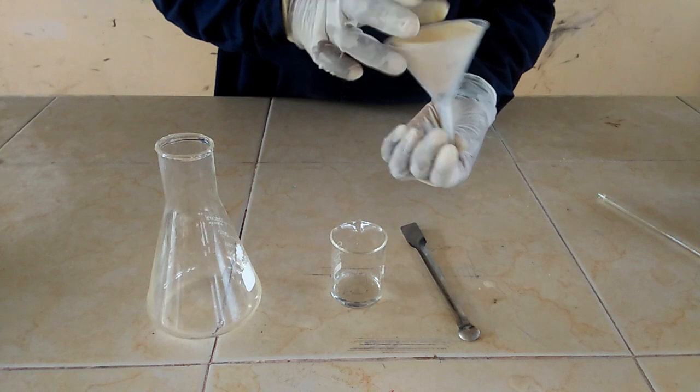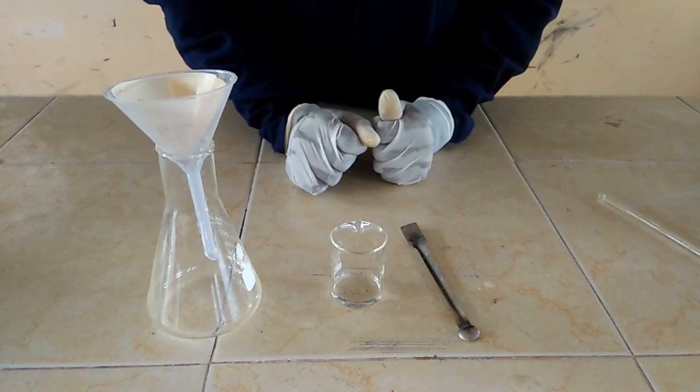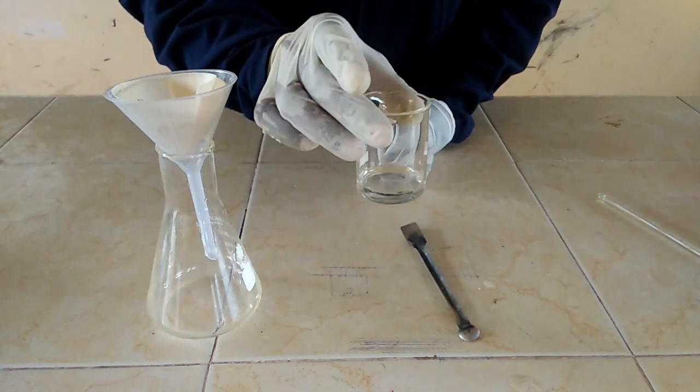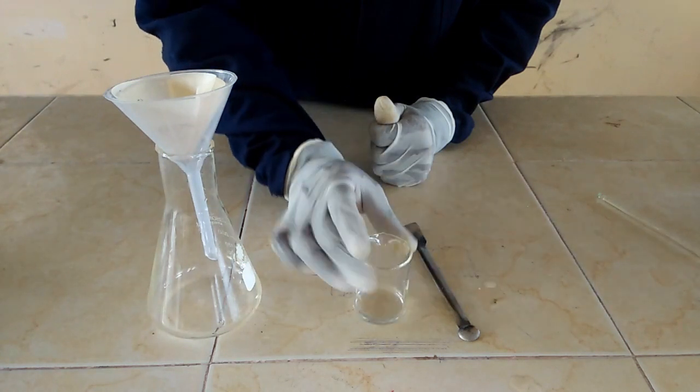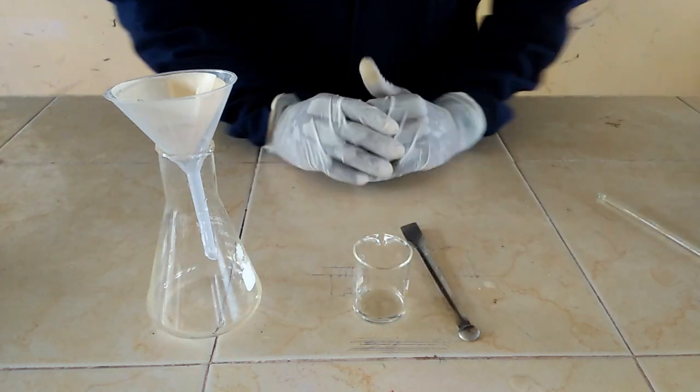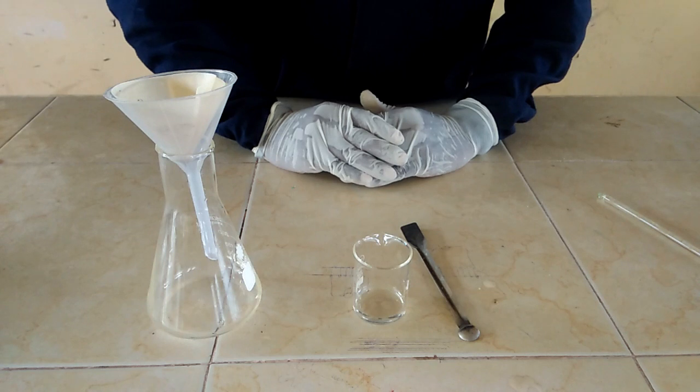So we have been able to separate the mixture of soil and water. Our water is very clean, and therefore you can use it for different purposes.